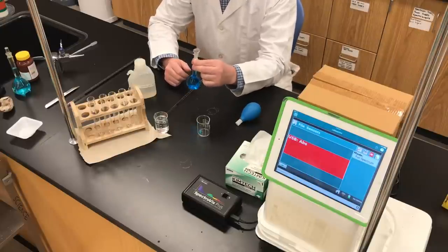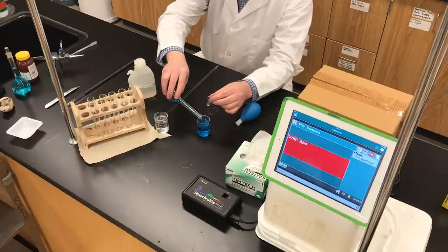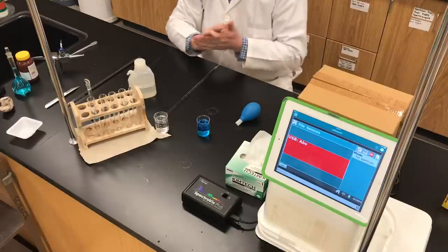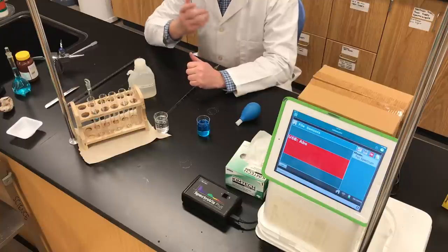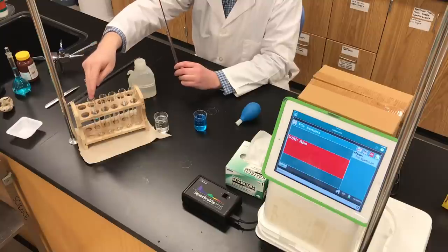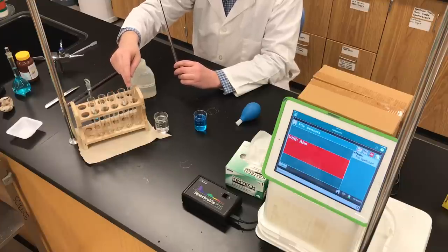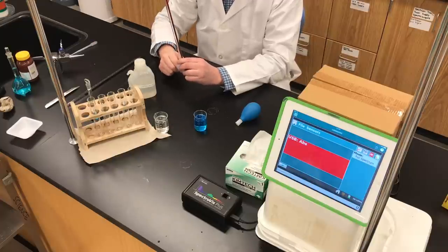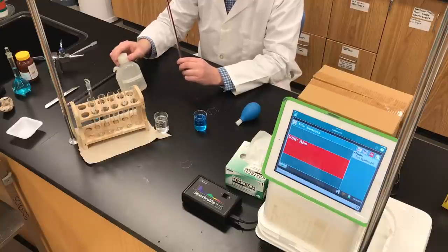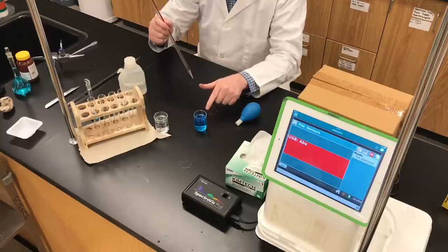I'm going to pour some of the standard copper nitrate solution into a 50 milliliter beaker, and I'll set the remaining solution aside. I have five test tubes, and I'm going to create five dilutions. Using a Mohr pipette, I'll deliver 1, 3, 5, 7, and 9 milliliters of the copper nitrate into the five test tubes respectively. Then I'll dilute each with distilled water to bring the total volume in each test tube to 10 milliliters.